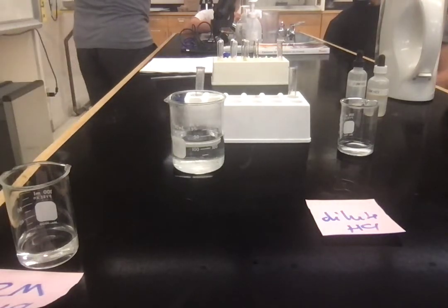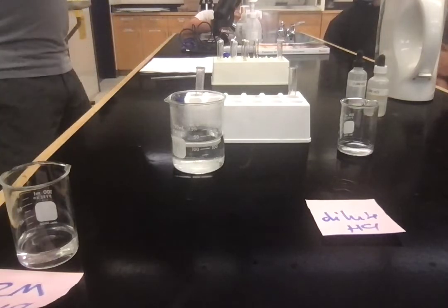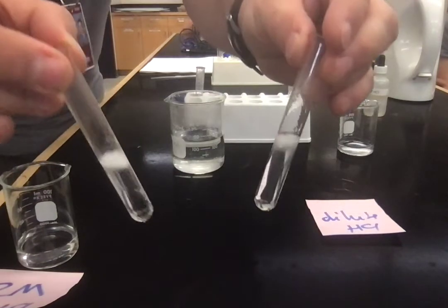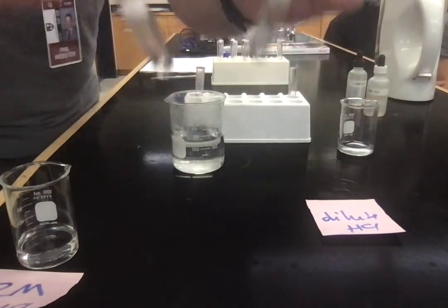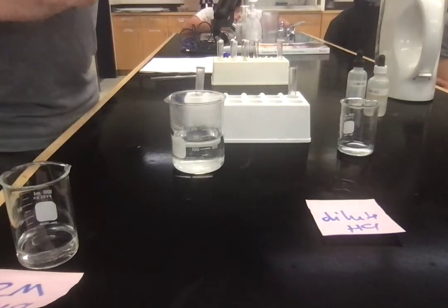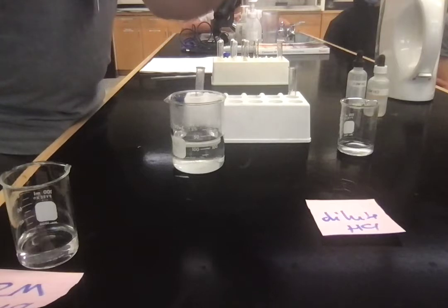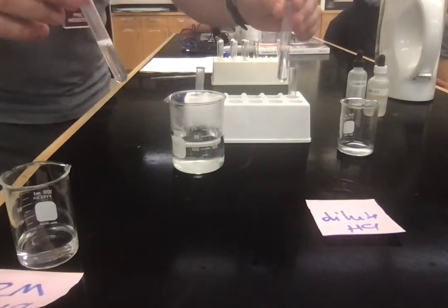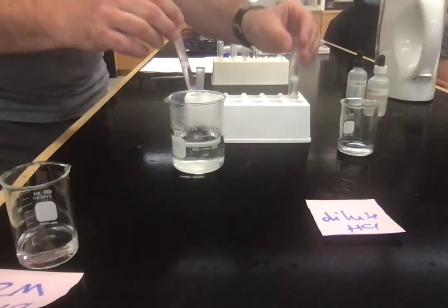This is the hot one. You don't need to just sit there. Thank you. Okay, looks faster. Okay, so the hot one, bubbling more vigorously. I can't do that because that's hot already, right? I can tell that this one's warmed up, but I can't tell if that's changed temperature or not. If I had a thermometer, maybe, I don't know.